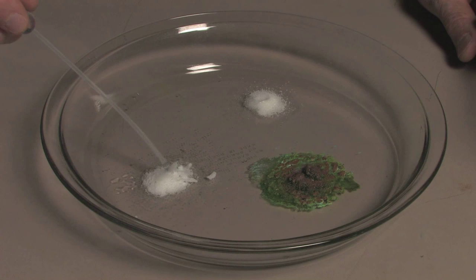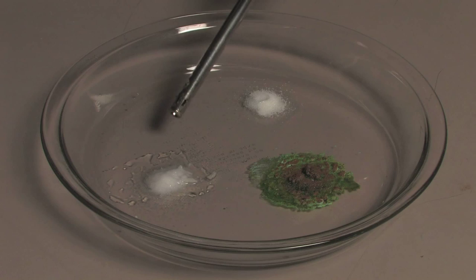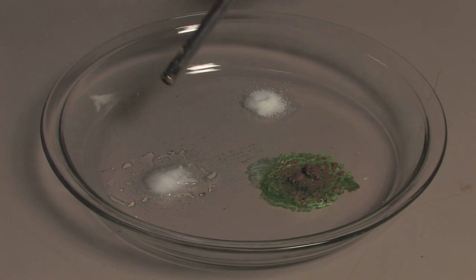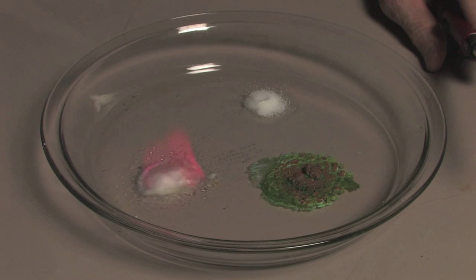Let's try our third reaction. And lithium chloride is a beautiful magenta red color.